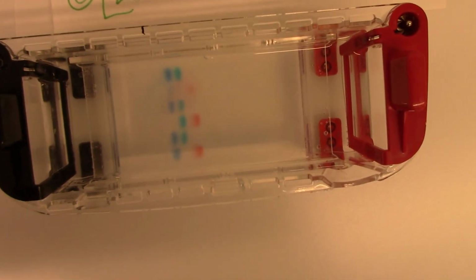These are your results. And now we have to analyze those 3 samples to decide what this tells us. Again, that's part of the process, is to reach some conclusions on the power of restriction analysis and reach some conclusions on these 3 samples that are presented to you.